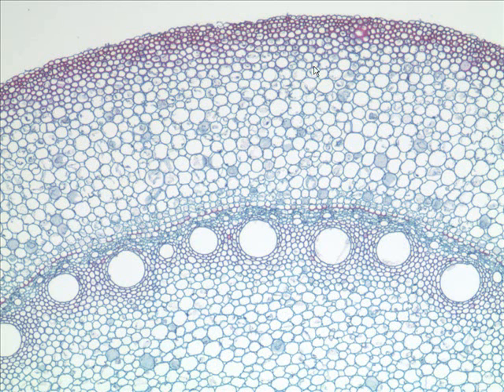Same thing down here. What is this tissue called? It's called parenchyma. How would you characterize parenchyma? Thick-walled or thin? Thin-walled. What else? Shape? Soap bubbly type shape. All right, parenchyma tissue.